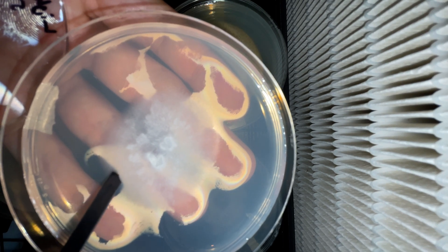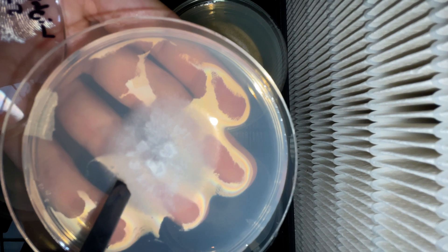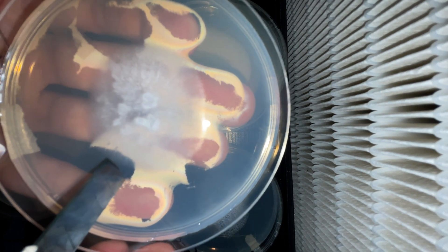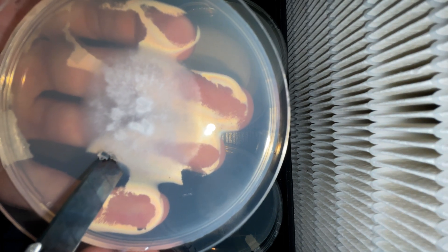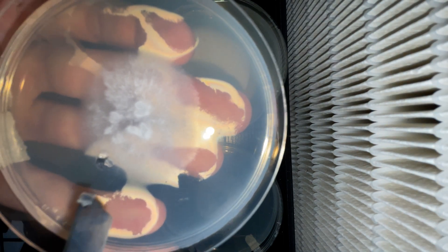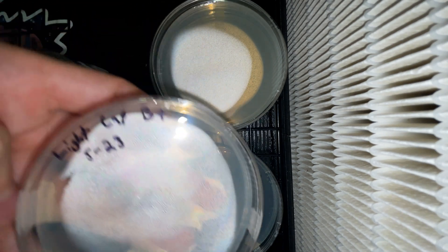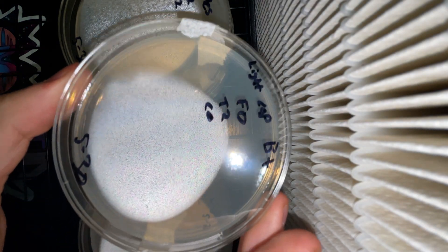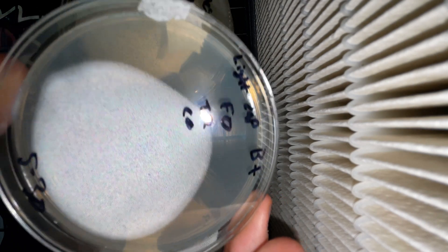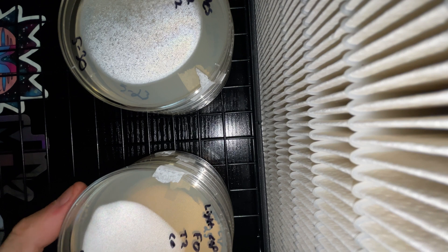Another thing I've noticed is that while working on these plates without gloves, I really don't like how they fog up. The problem is I can barely see the mycelium while I'm working on it to begin with, and then on top of that I can't really see over the mist. I might go back to gloves. Once you're finished up, just make sure to date and label each of your plates before packing up. Nobody likes mixed-up cultures, especially if they all look the same.